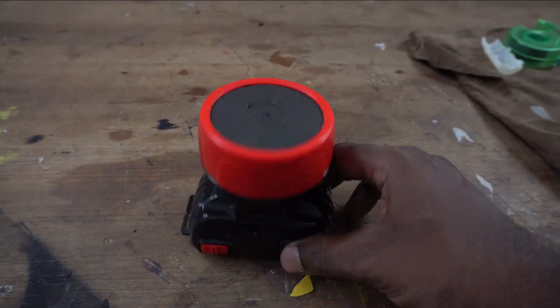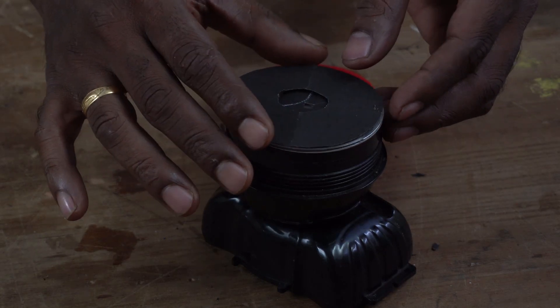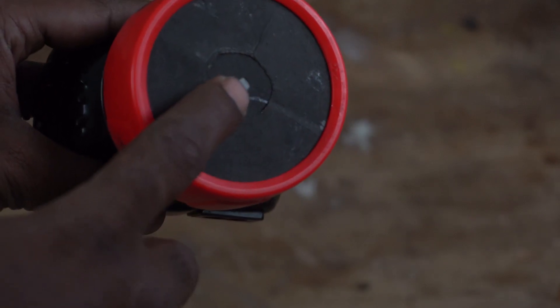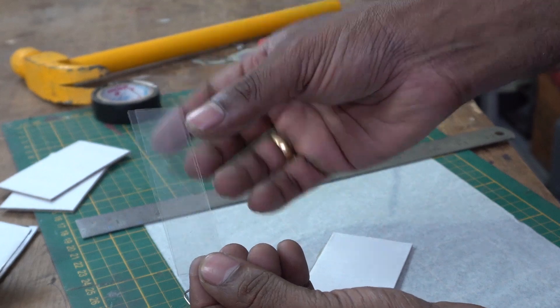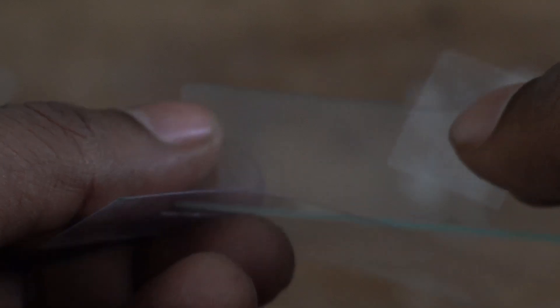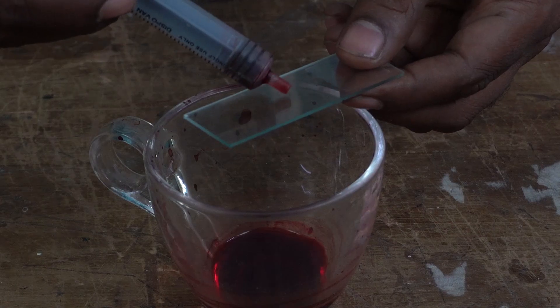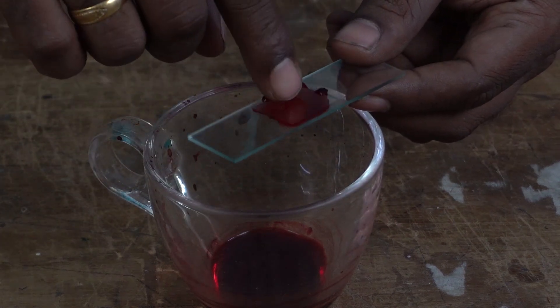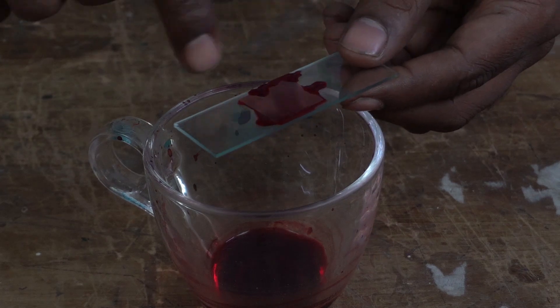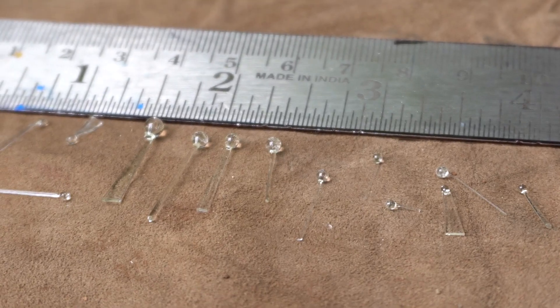We also need a proper light source, and I used a headlamp. A black chart with a small hole is inserted by unscrewing the top lid. The smaller piece here is my high-tech solution to vary the intensity of light coming through the torch. Last time I used an OHP sheet instead of a glass slide, which was a bit wobbly. Having a glass slide gives a bit of stability and visibility, and the cover piece makes the surface flat — this makes focusing a lot easier. Staining the specimen is important. Although iodine is used for this purpose, I am using food colouring. A drop of this colour can be placed on the specimen, the cover slip is placed on top. Make sure there are no air bubbles trapped between the slide and the cover slip, and remove the excess liquid with blotting paper or cotton.